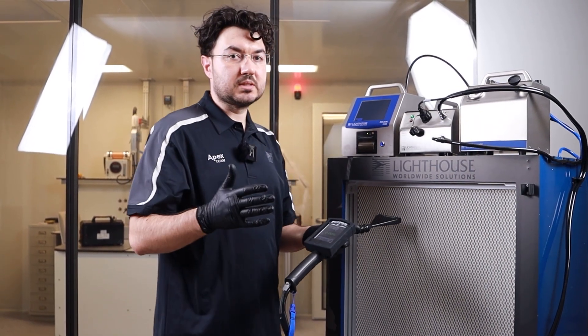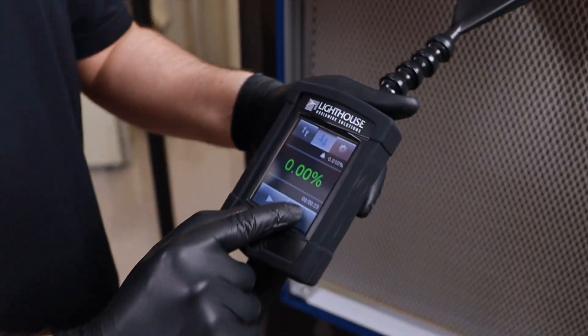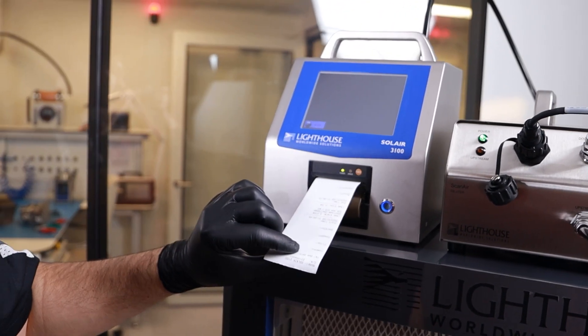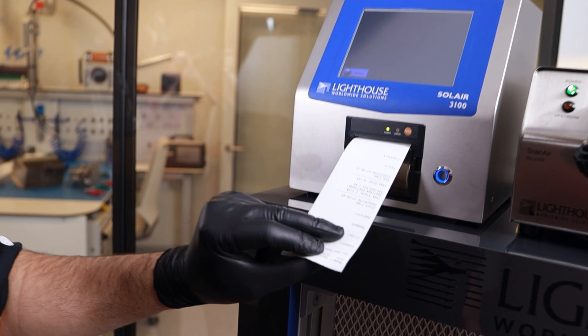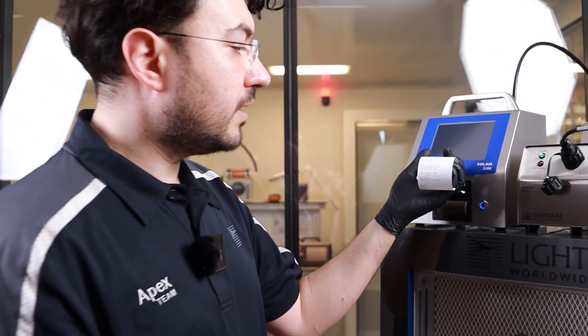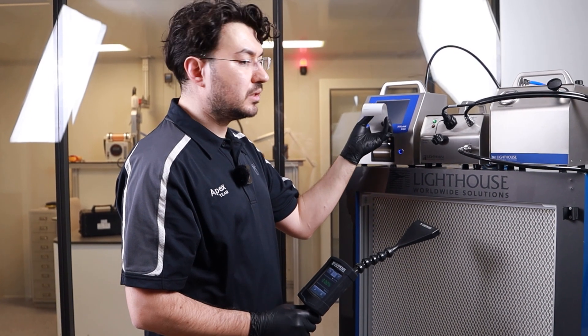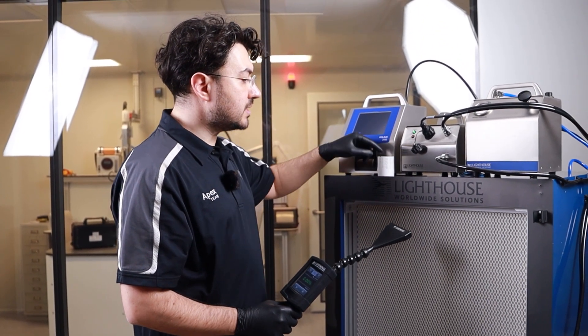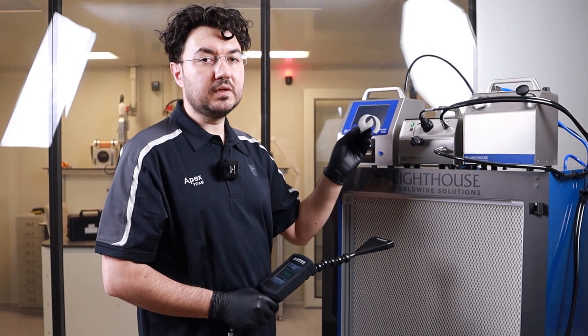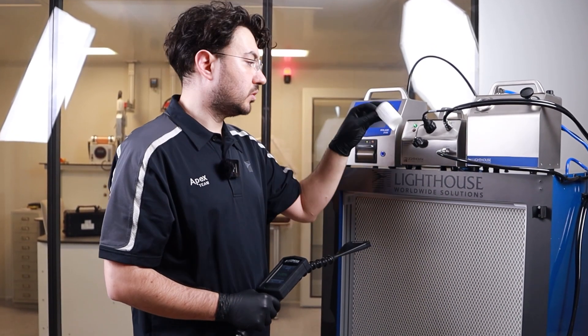Once you find all the leakage points, click on this printer mode, take out the sample with the serial number of your device, calibration due date, company, filter, aerosol that you are using, start time, leak alarm level, leak size, your upstream challenge and your end time. And your result with the signature of your operator. This is a nice output for each and every HEPA filter so that you will know what happened in the field when your operators start and when they finished with the upstream value of your testing.